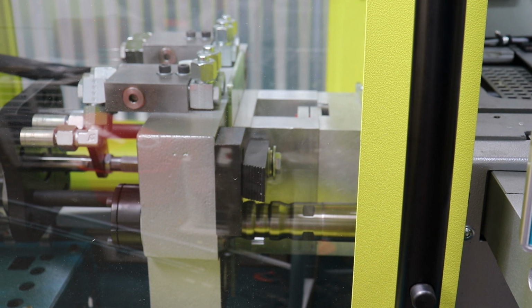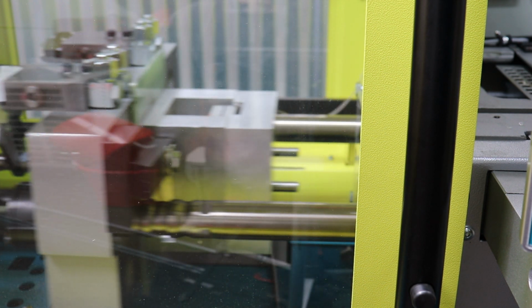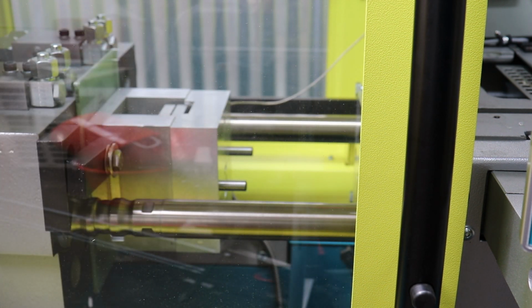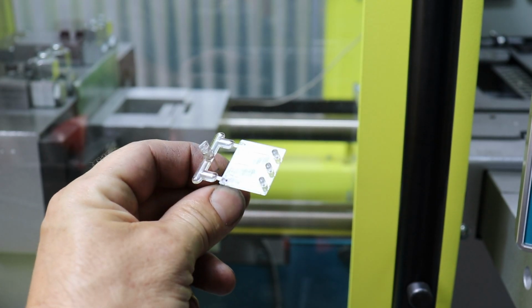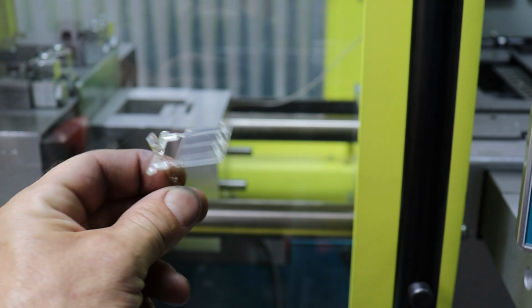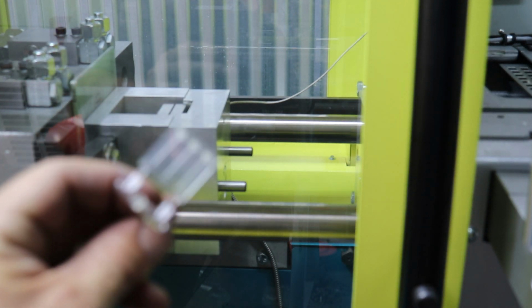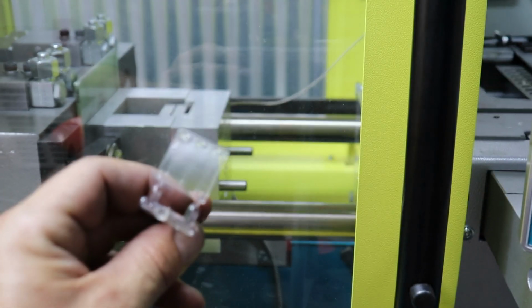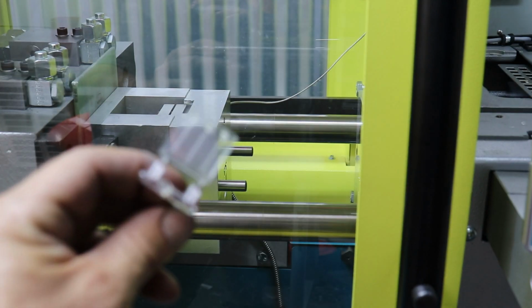Okay, now we got 5.2 millimeters of cushion, which is the amount of plastic left in the shot that the machine uses to push on to pressurize the mold. And now we're going to open up, and okay, there we ejected again. You should be able to see that the back has filled out. So we're fully packing our mold now, but we're not really flashing anywhere, so I think we've got a good profile.